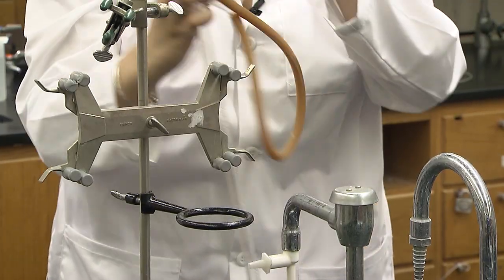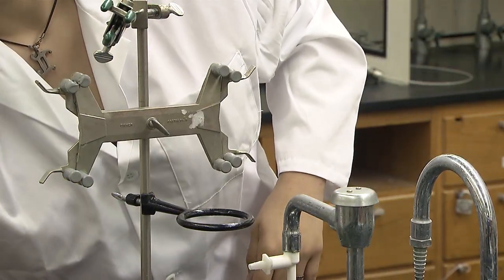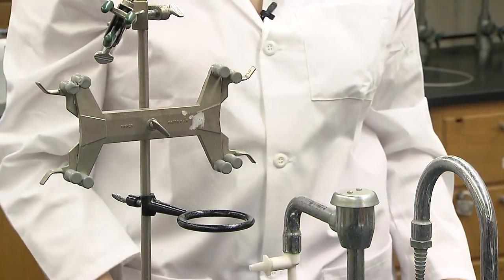The pressure in the burette comes from oxygen gas and water vapor since the gas was collected over water. When the lab instructor tells you the atmospheric pressure, you can figure out pressure from water vapor and the pressure of oxygen gas. Pay close attention to the units used for each calculation. You will have pressure, temperature, volume, and number of moles. With those, you can get the R constant.